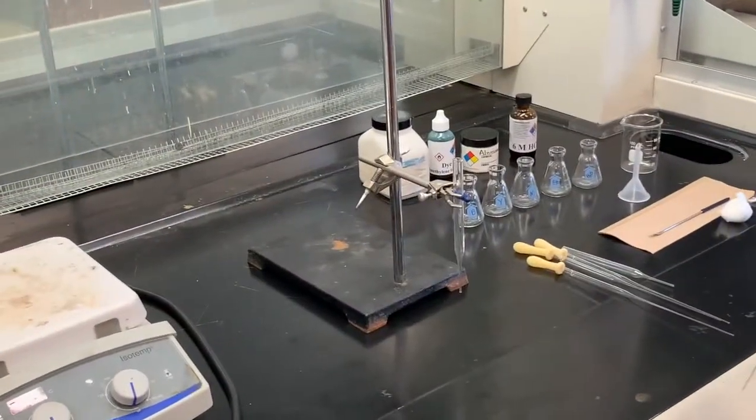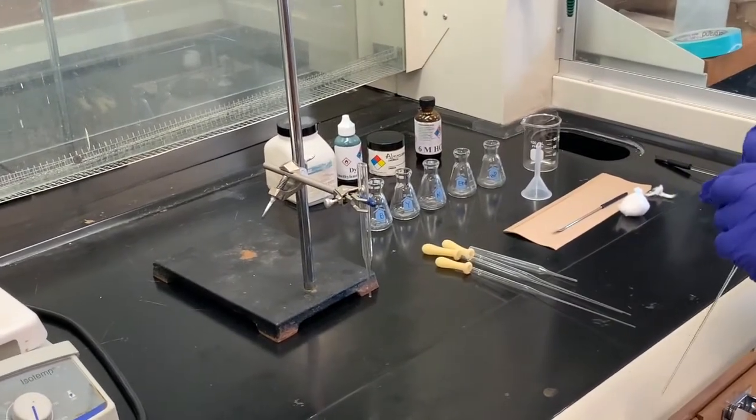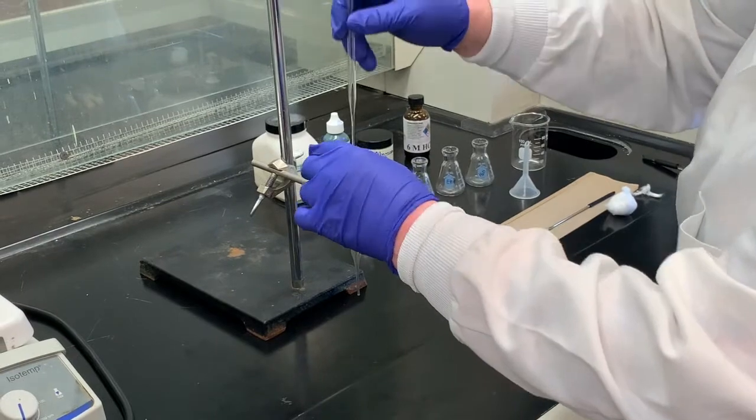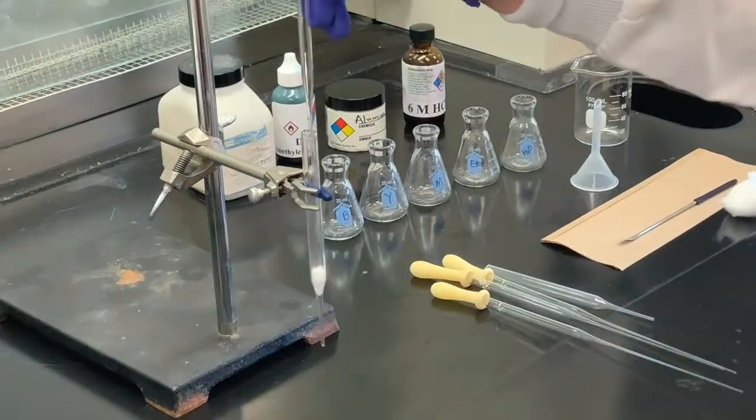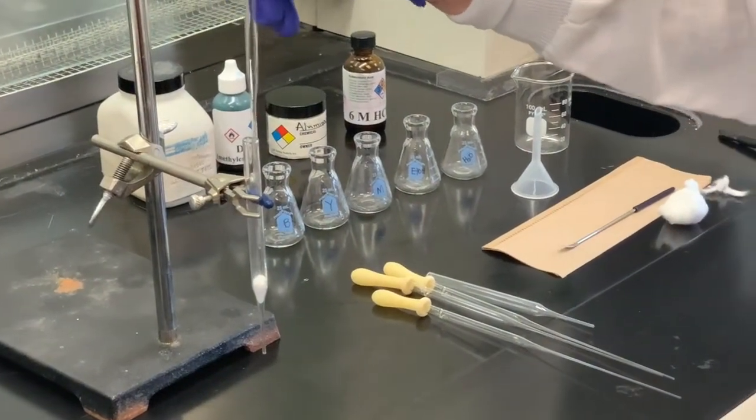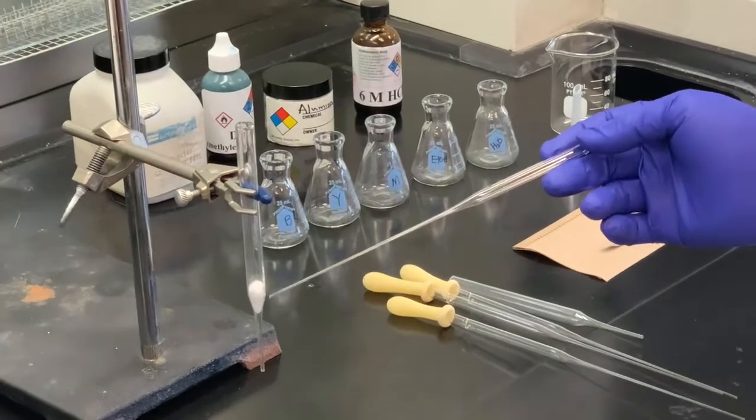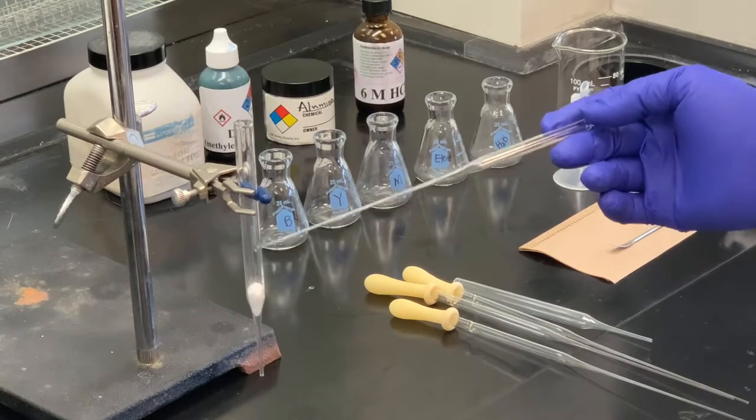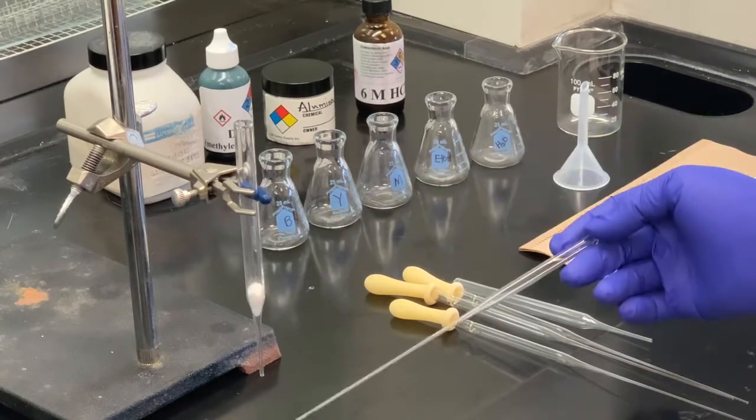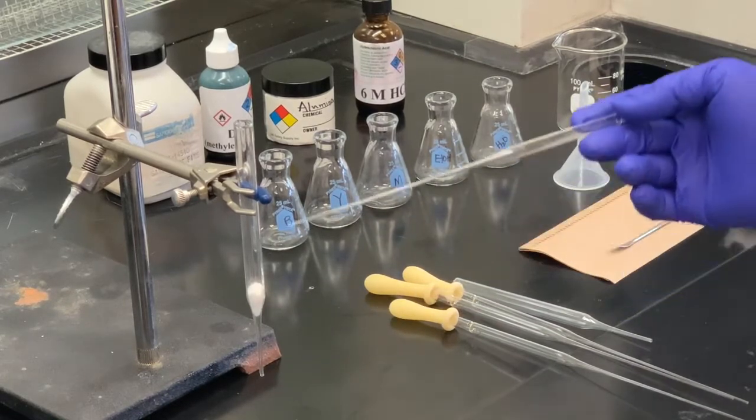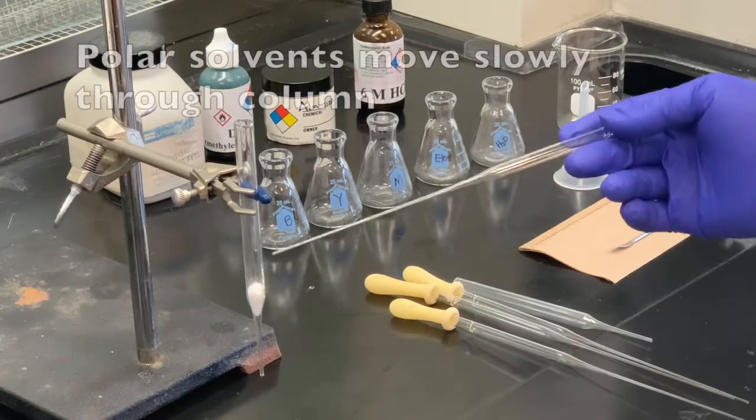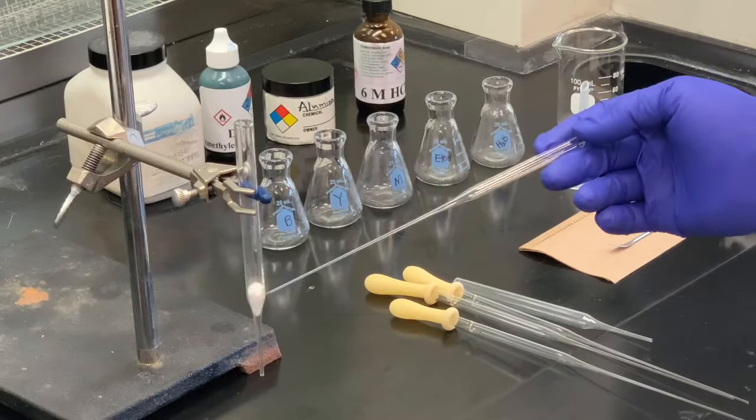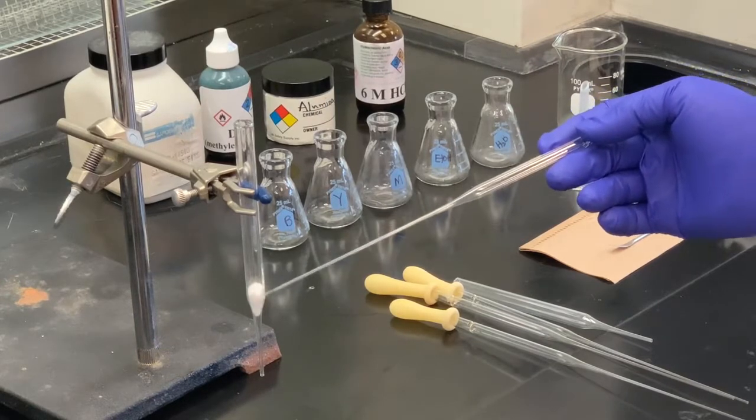So I've got a piece of cotton. We don't want to go too tight, but we want to make sure we can collect it and have most of the material to go through. Sometimes you can kind of tell if you pack too much cotton in there or too much of the glass wool, because if it's draining extremely slow, and this is going to be slow to start with because we're using various polar solvents. But if it hardly drips at all, then one of the errors we may have made was to use too much.